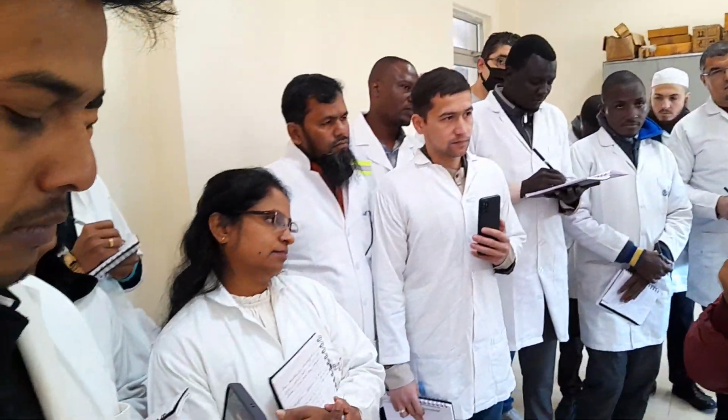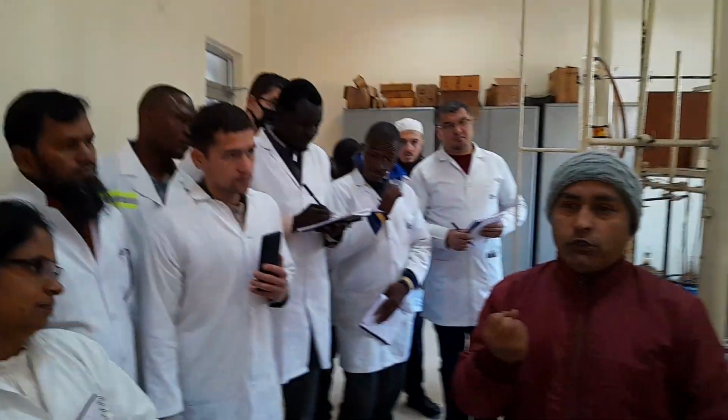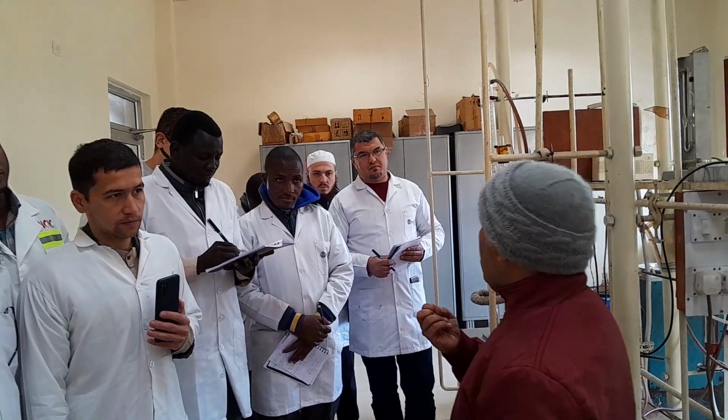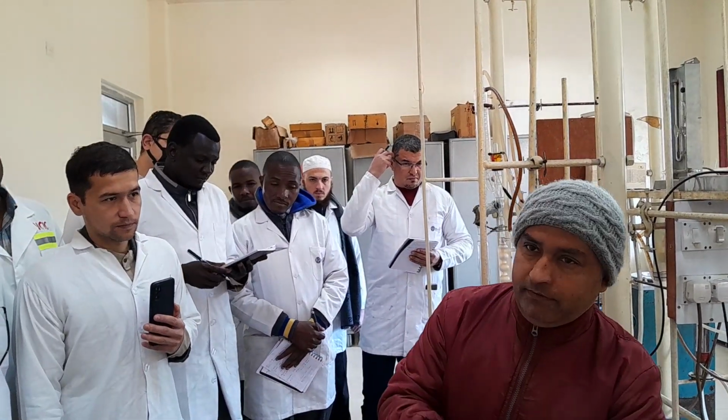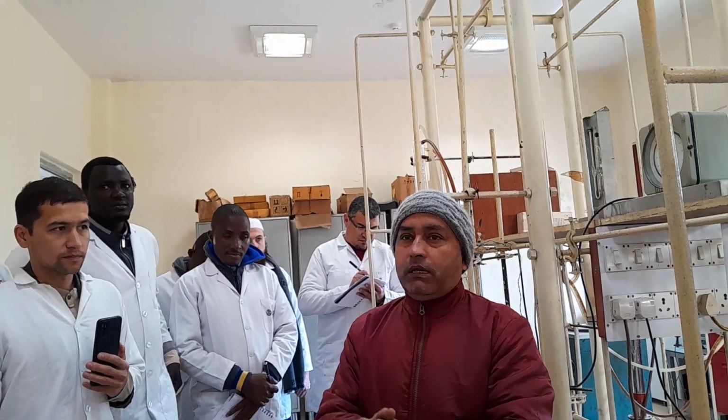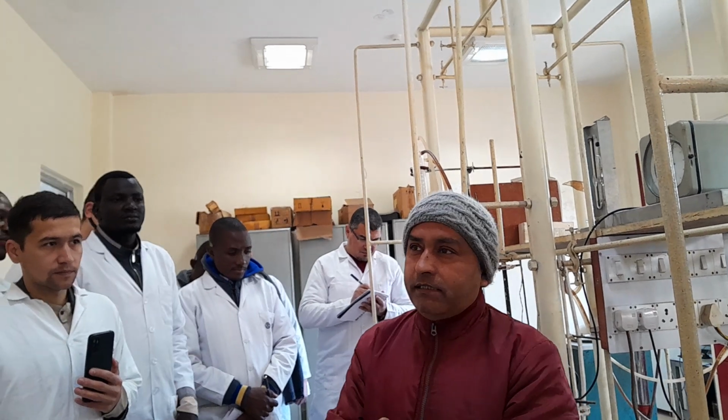Isn't it? Can somebody explain what you mean by azeotrope? Azeotrope. A close boiling point mixture. In layman's language, you can say close friends. So you will take a solvent which can make a close friendship with water, one which has a boiling point near to water. So I am taking toluene, because the boiling point of toluene is 108 and water is 100. So it will carry that water along with the toluene.